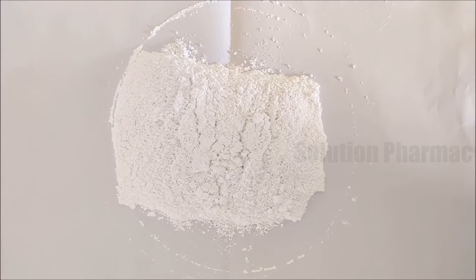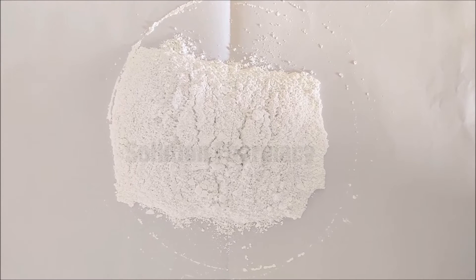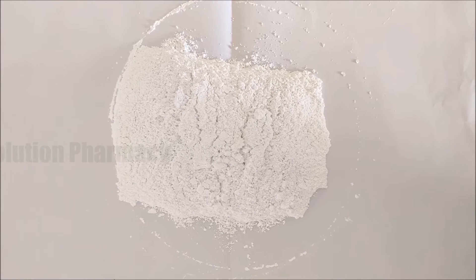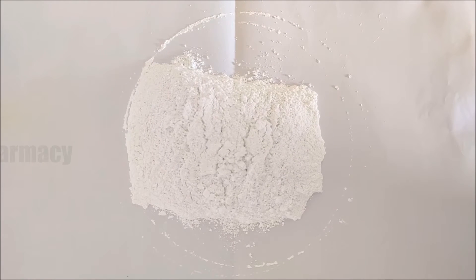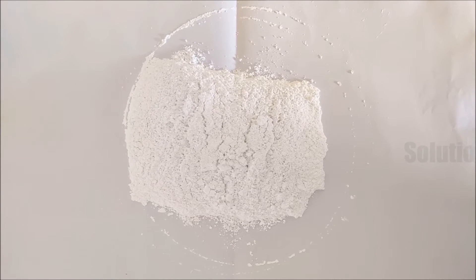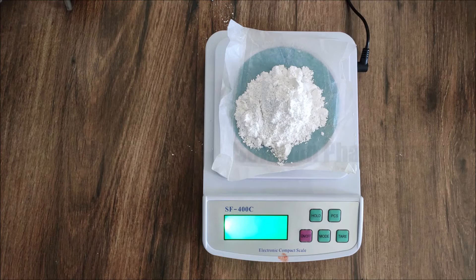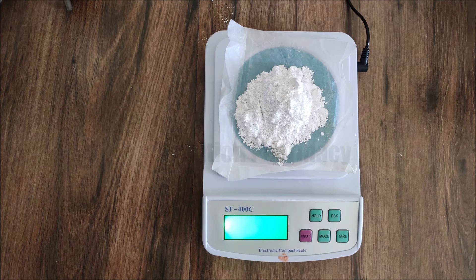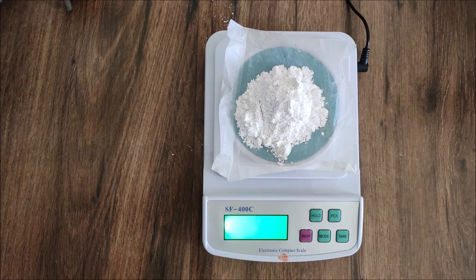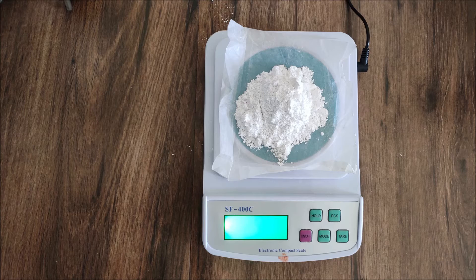This powder is of the heavy category, meaning it has a low bulk volume or high bulk density — for example, heavy magnesium oxide or heavy magnesium carbonate. Light powder means powder with high bulk volume or low bulk density — for example, light magnesium oxide or light magnesium carbonate. For light powder, we can measure 5 or 10 grams for a 100 ml measuring cylinder. Since our powder is heavy and our cylinder is 50 ml capacity, we have weighed 25 grams of powder twice to fill both measuring cylinders.